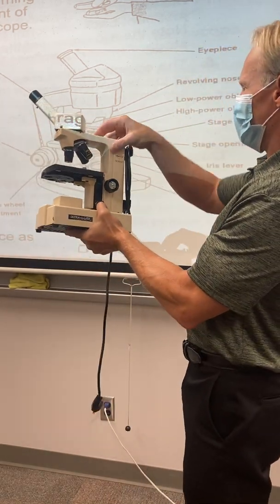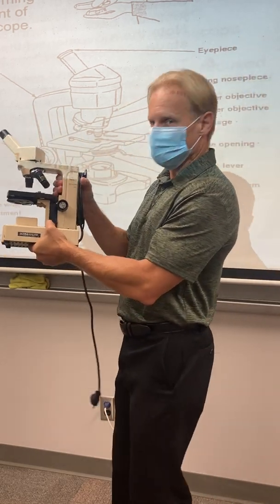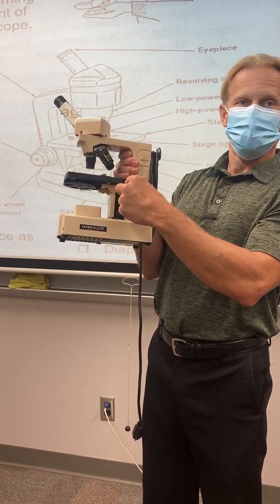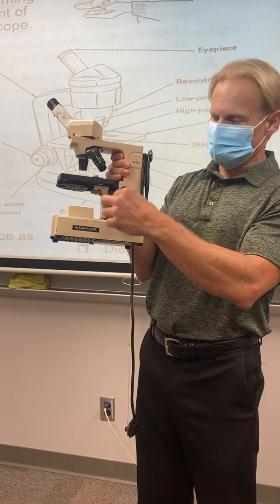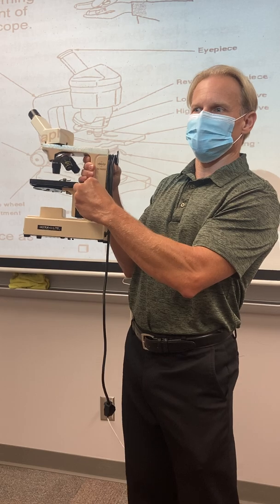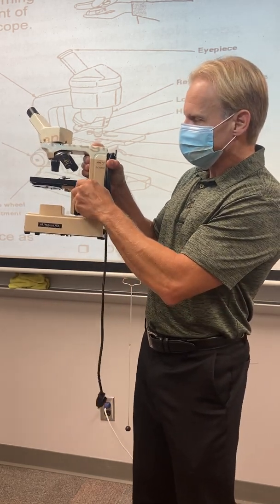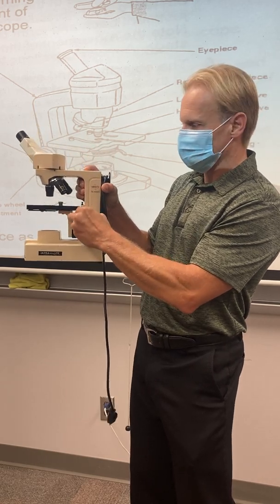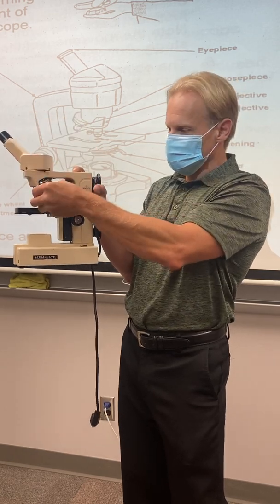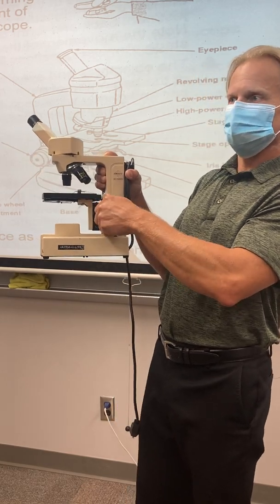So going along with this, we've got our arm. The wheels that adjust the focus are down here. Now on some of our scopes, there's 2, and in others, there's one that's inset in the other one. The one that spins really easy is the fine adjust. This is the fine adjust, the little knob. The coarse adjust is the big knob, this big thing here. You can see on this one, it's actually raising and lowering the stage, which is this flat part here. On other scopes, it might move the other piece, but it's going to change the distance between them somehow. And the coarse knob really moves it a lot.